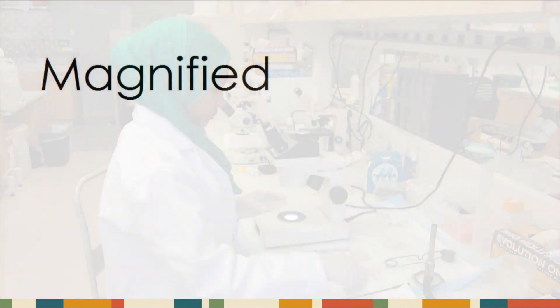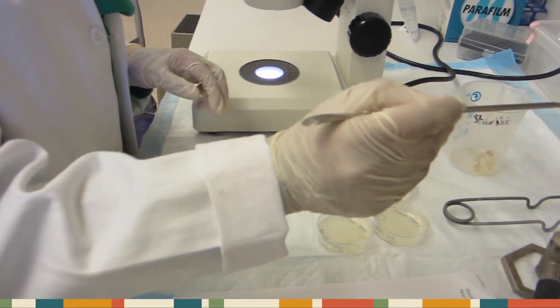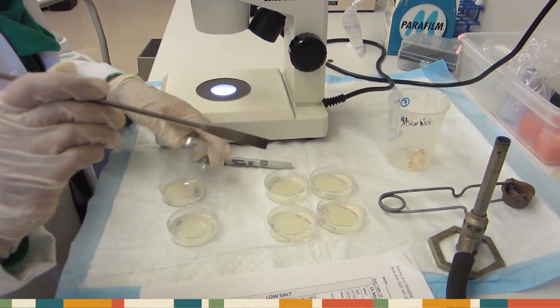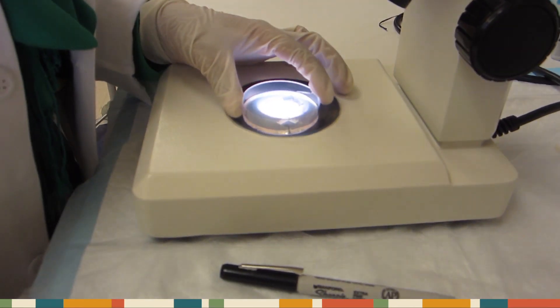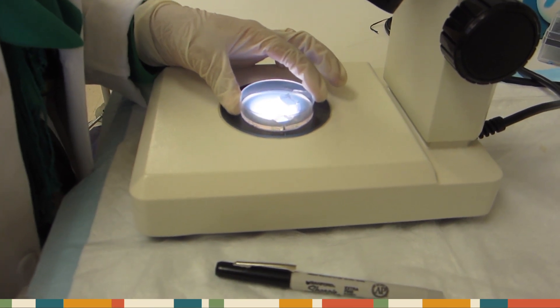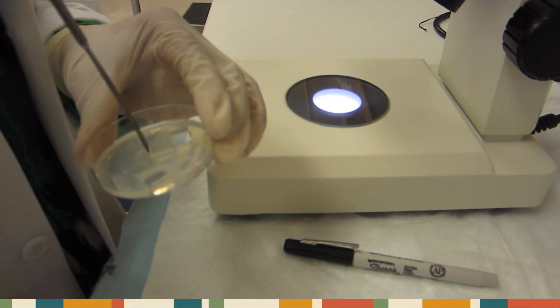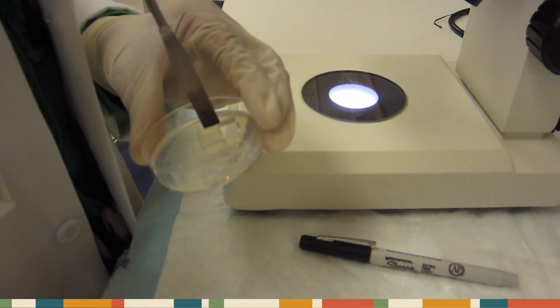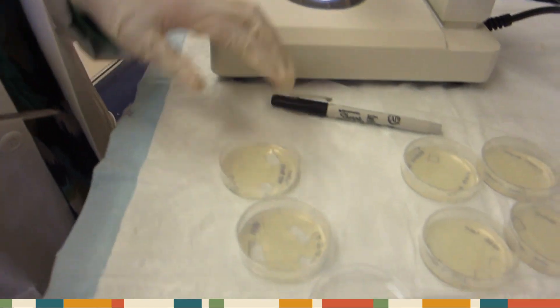After you've finished with your wild-type worms, you move on to the mutants. Remember to sterilize between each new plate. Place your plate under the dissecting scope, find the most populated region, and dissect it. Remember to cut into two different pieces for your low-salt and high-salt plates.